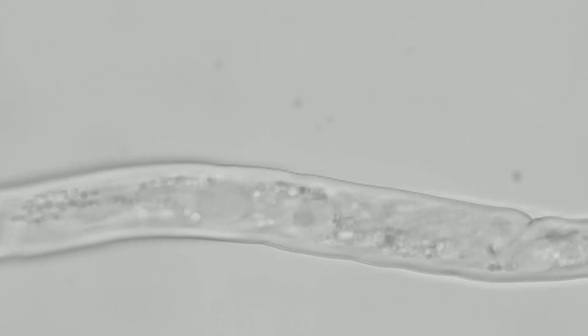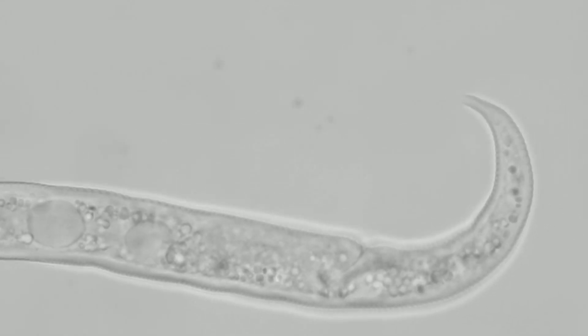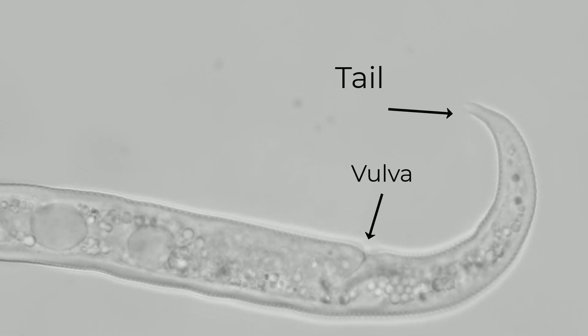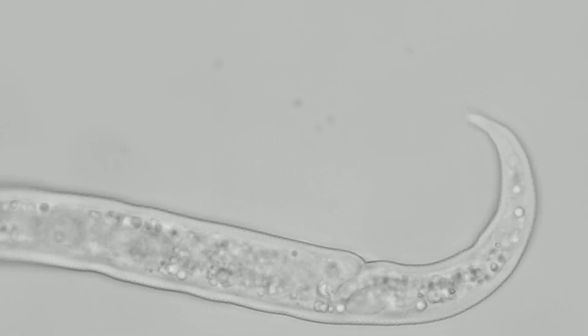To conclude, due to the lack of enough diagnostic features, it takes practice to confidently identify nematodes of this genus.